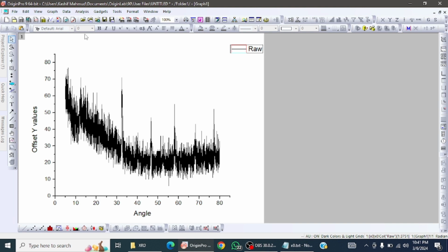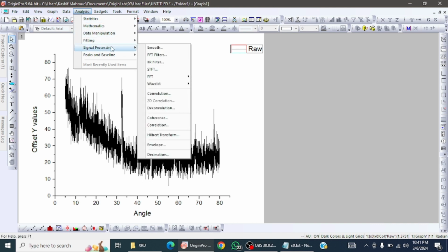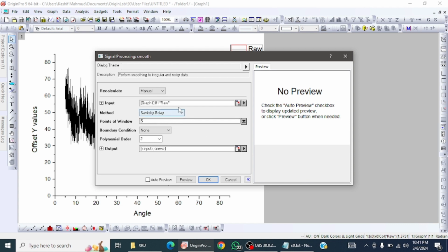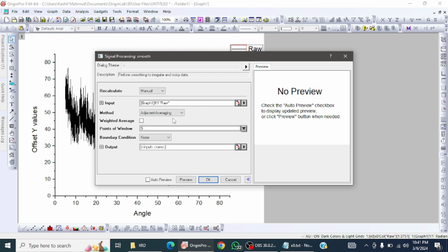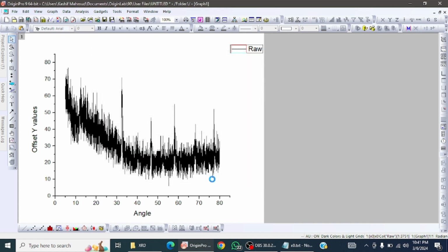There are 2 to 3 ways, but I recommend that for a single set, go to Analysis, then Signal Processing, Smooth, and select Advanced and change this number to 10. And then if you want to preview, it will be like this.